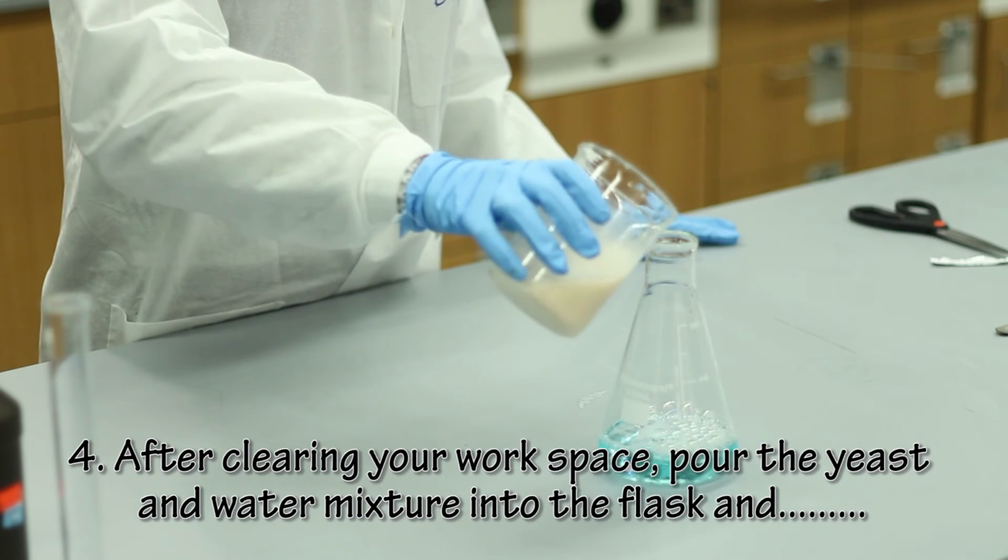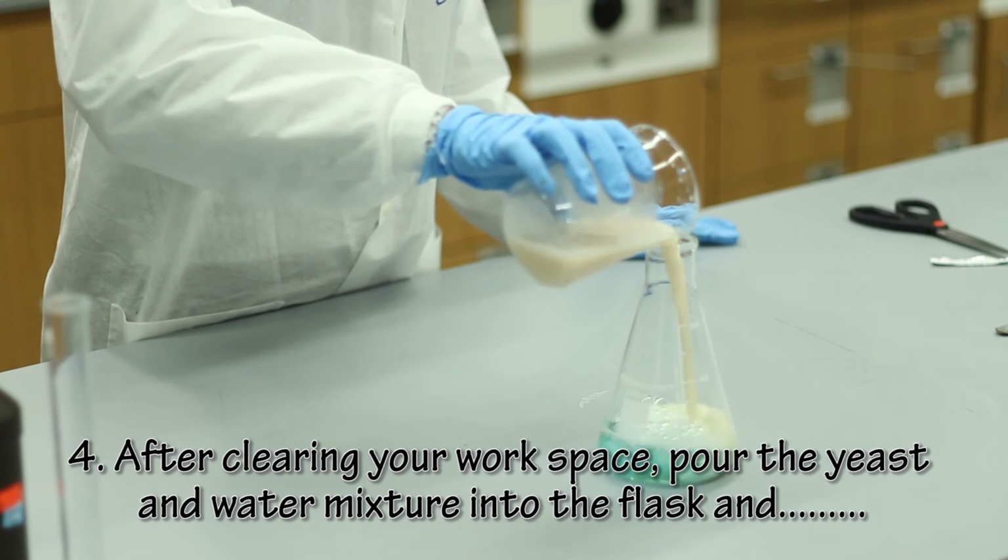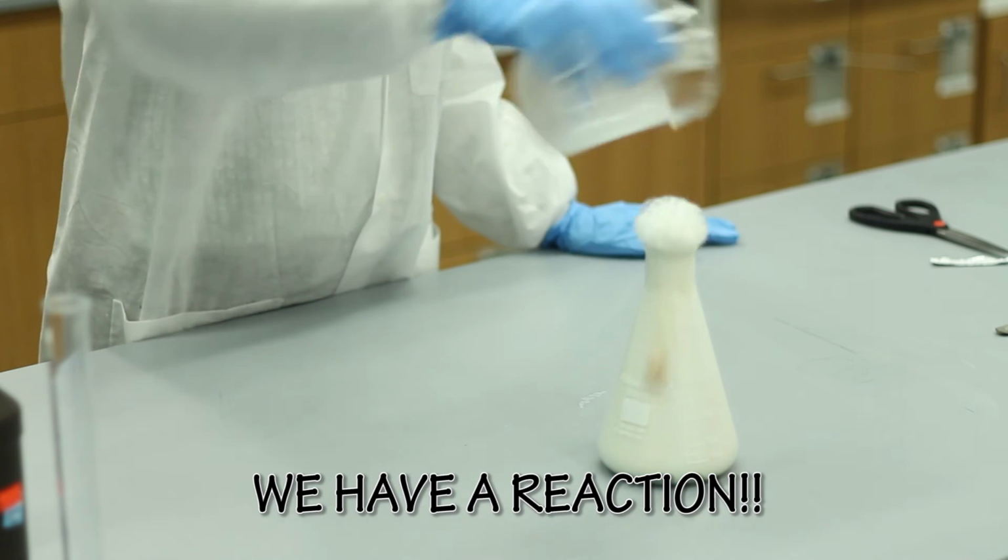Pour the yeast into the flask, and we have a reaction.